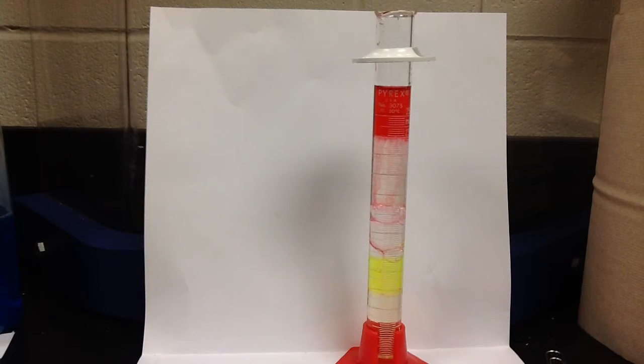Okay. Now, what we can take away from this is that when liquids are poured together in a density column, they're going to settle out according to their densities. Alright? And now what I'm going to try to show you is a paper that illustrates the idea. Now that's the qualitative idea that they settle out by their densities, but what are those densities?